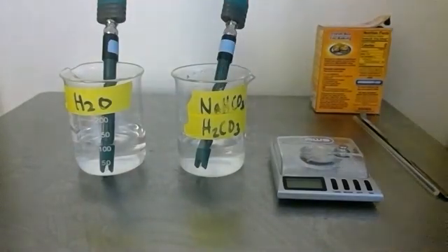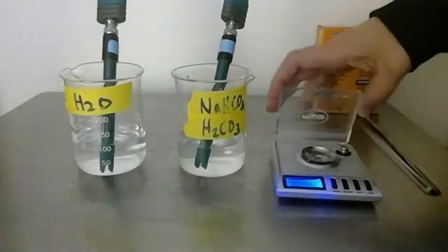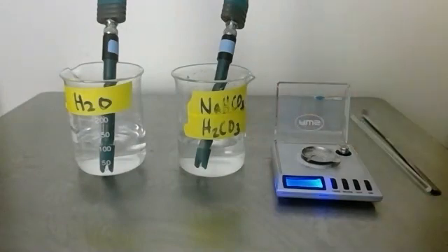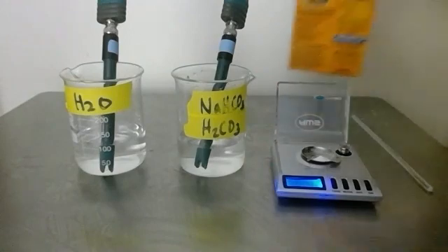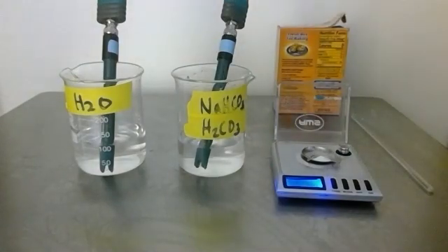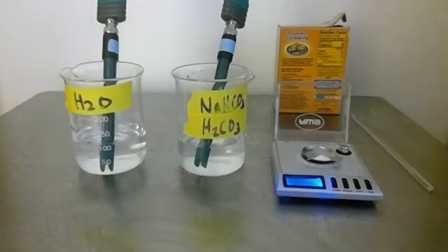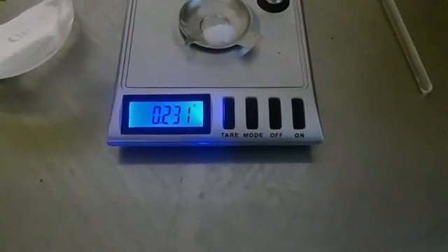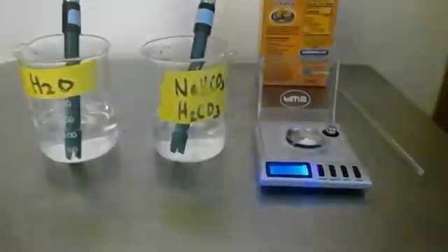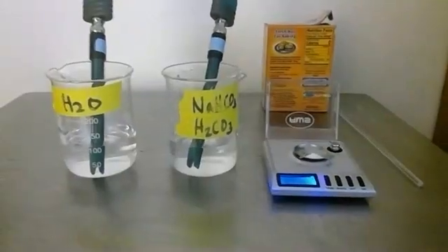The next step is we're going to add 0.2 grams roughly of sodium bicarbonate to our solution, and sodium bicarbonate is just baking soda. I've tared my balance, it's at zero, and I add a little bit and it brings me up to 0.232 grams.